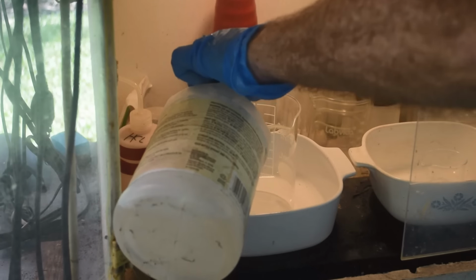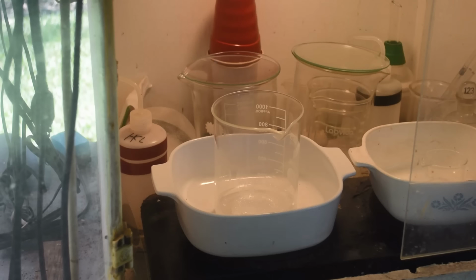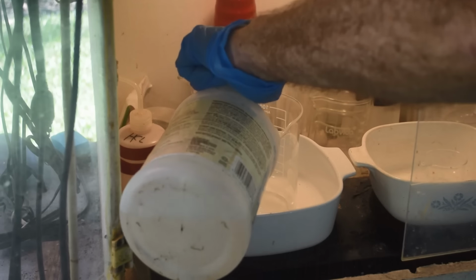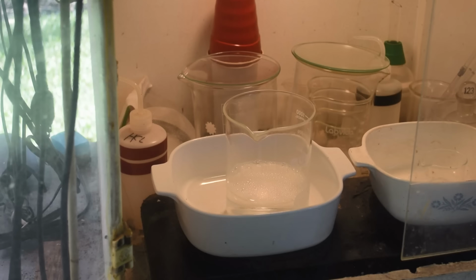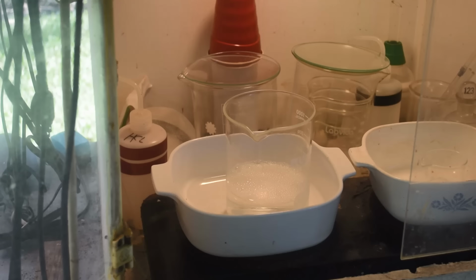Formic acid is a fairly strong acid for an organic acid, and ammonia is a fairly weak base, so I figure it's going to take a lot of ammonia to neutralize that formic acid. Let's see what that amount did with a piece of litmus paper here. Probably going to have to add more. Oh yeah, we are still quite acidic. So until that turns blue, we are acidic. My experience back when I was recovering tin from solution told me that, yeah, ammonia is a pretty weak base, and it takes a lot of it to neutralize a strong acid.